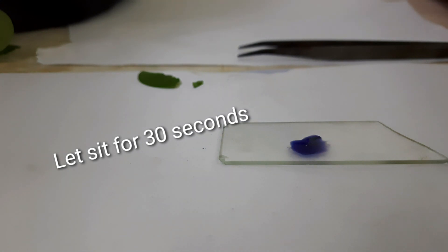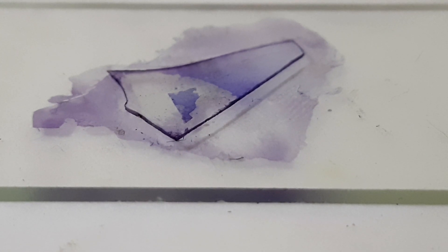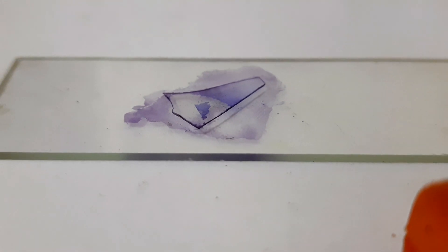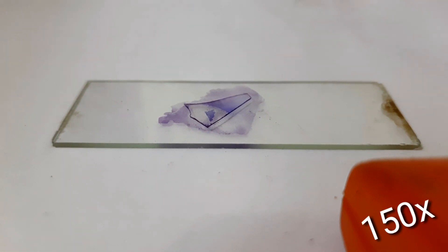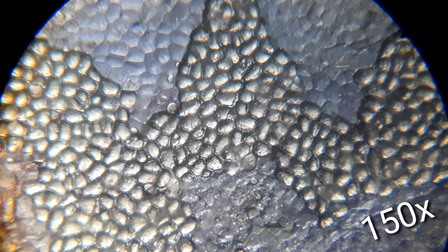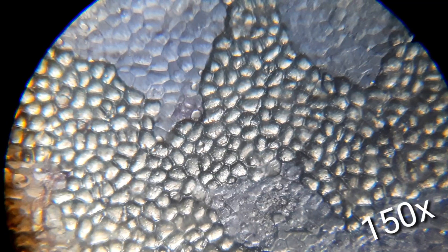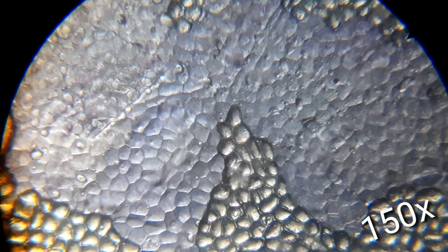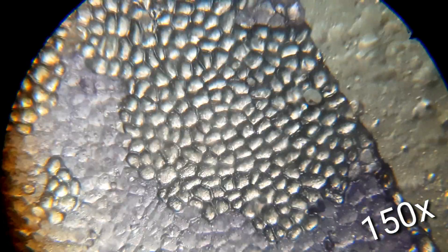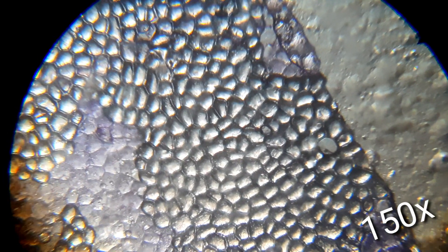I'm going to let it sit for about 30 seconds to one minute. I've got the coverslip on but it's kind of broken. It's no issue though — the sample is over there to the left. We are able to view things along with it, and as you can see there's some water getting away, and hence you can see the cells which are away from the blue stain and just looking transparent there.